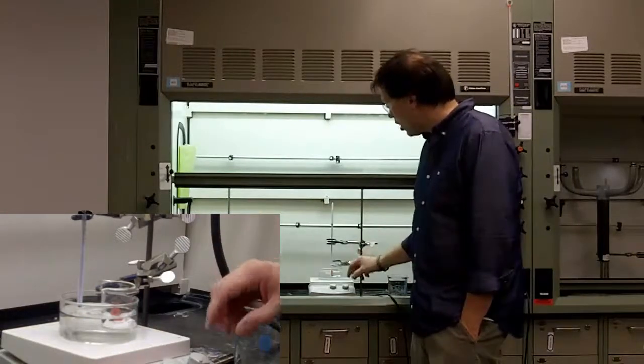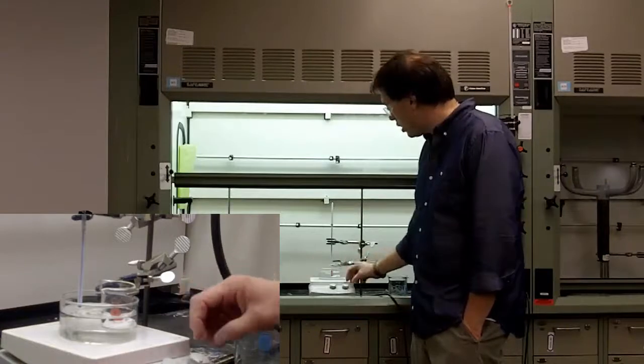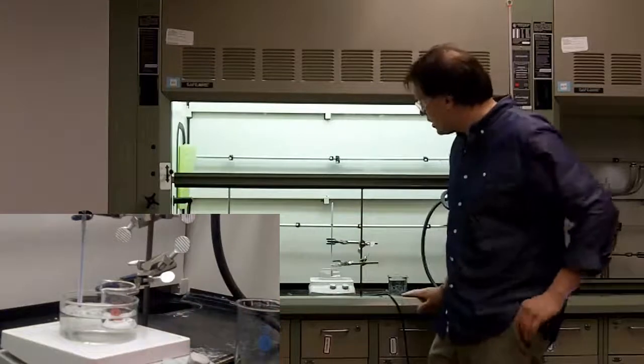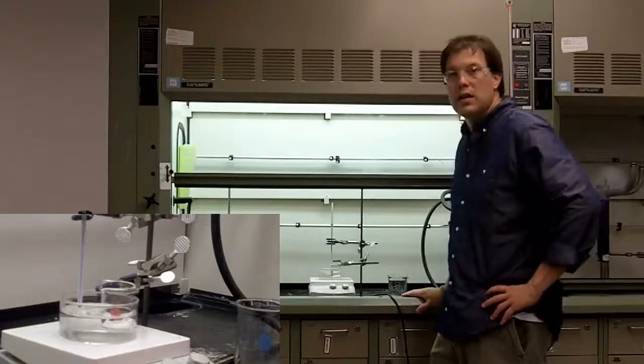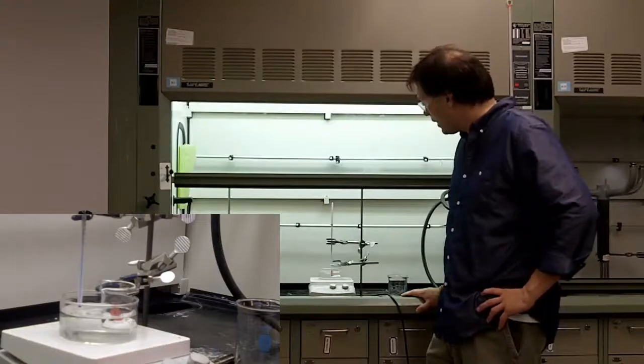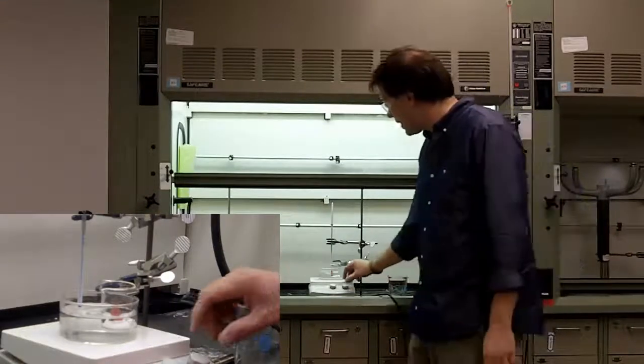So, to start with, we want to turn on the hot plate, and we just turn it on, and we're going to adjust the temperature to however we need it. Obviously, 100 is the highest we can go with water, and let's pretend that we're sitting at that temperature then.